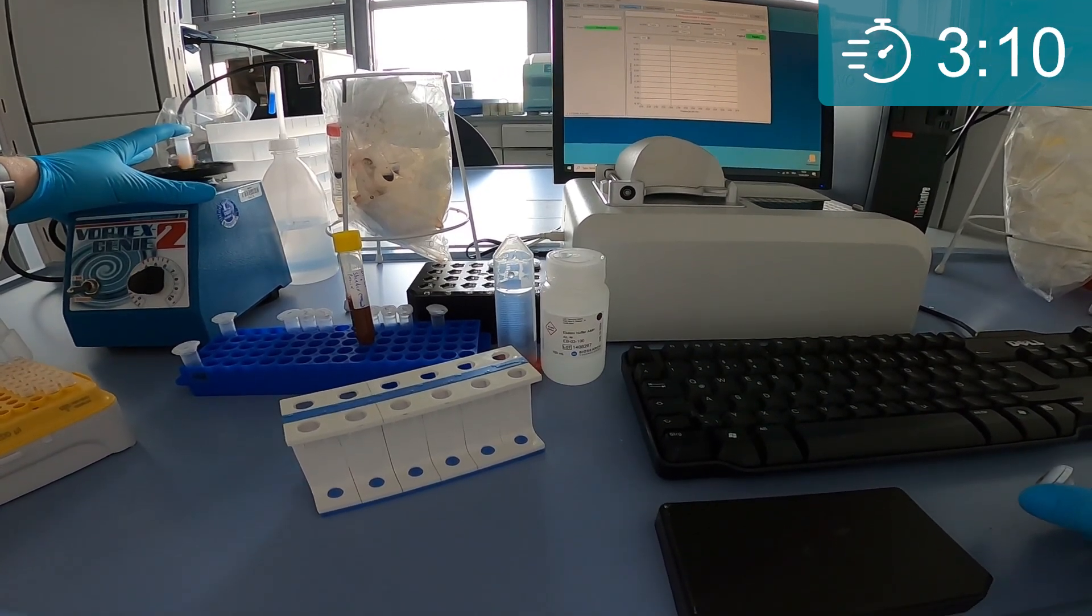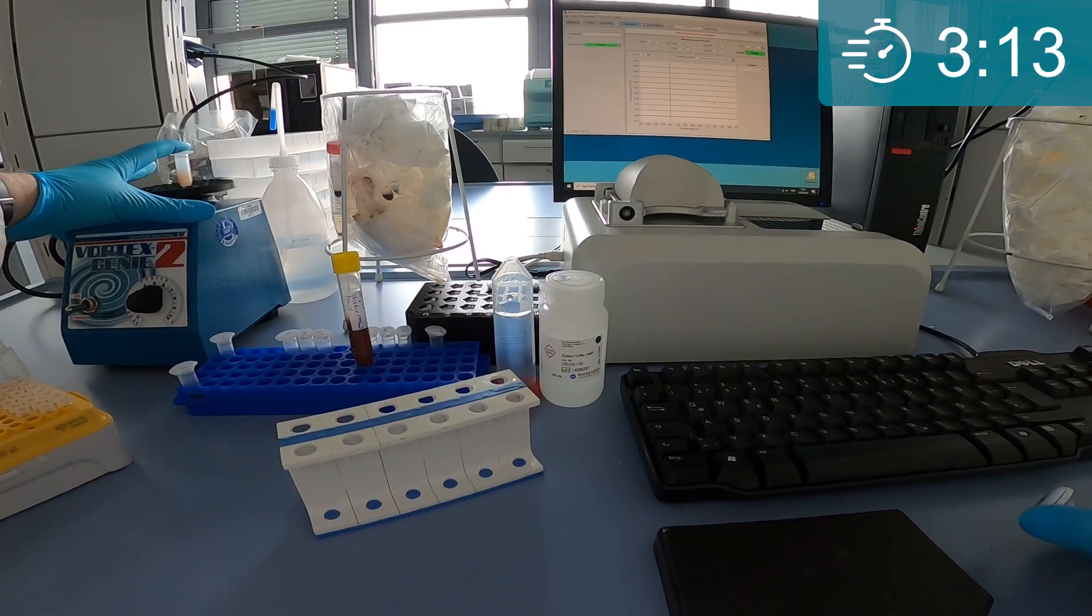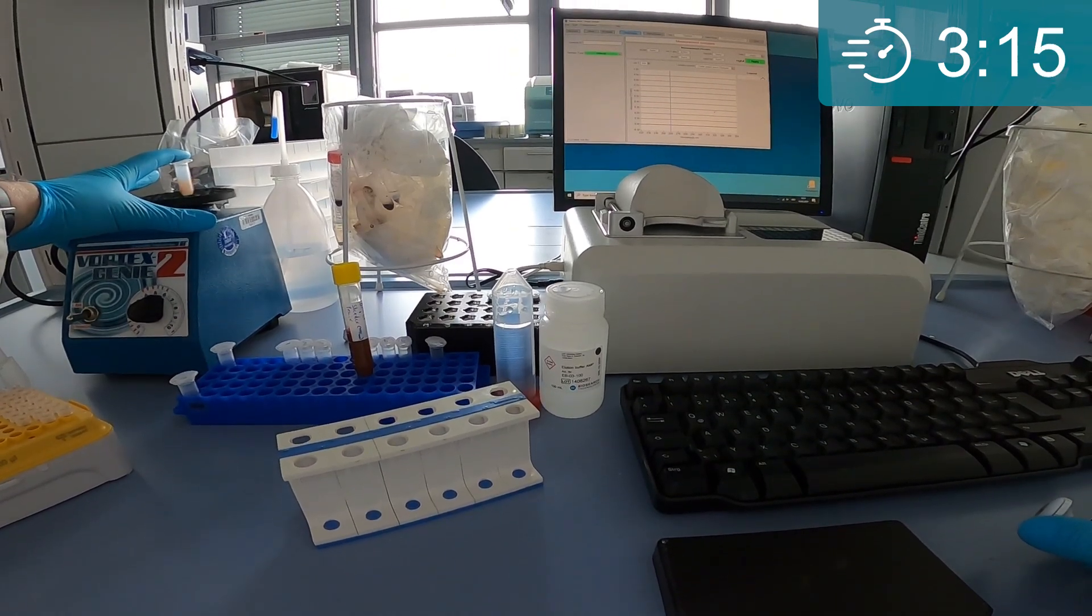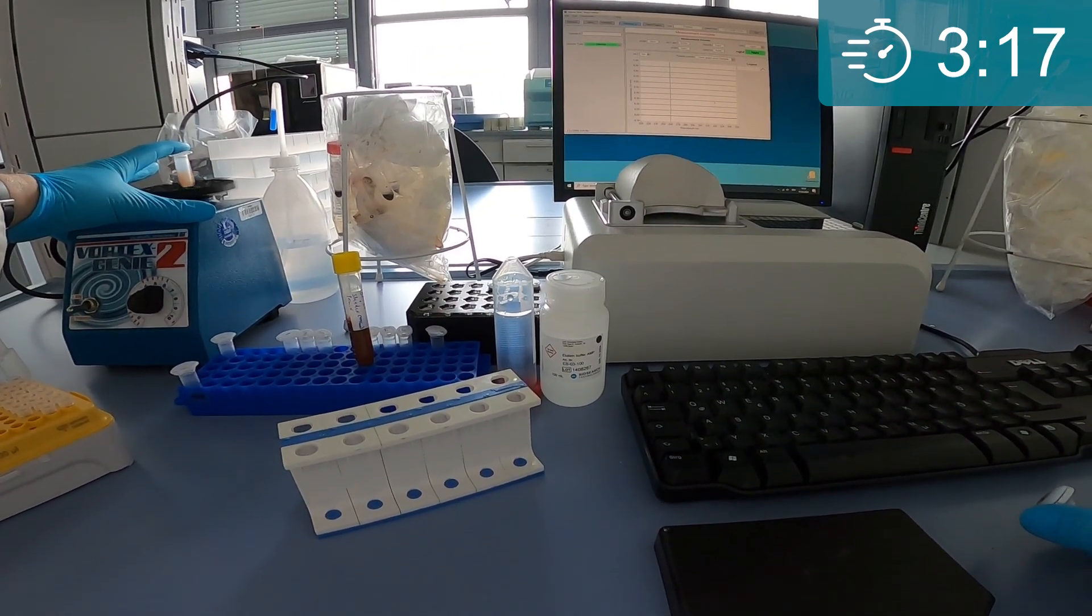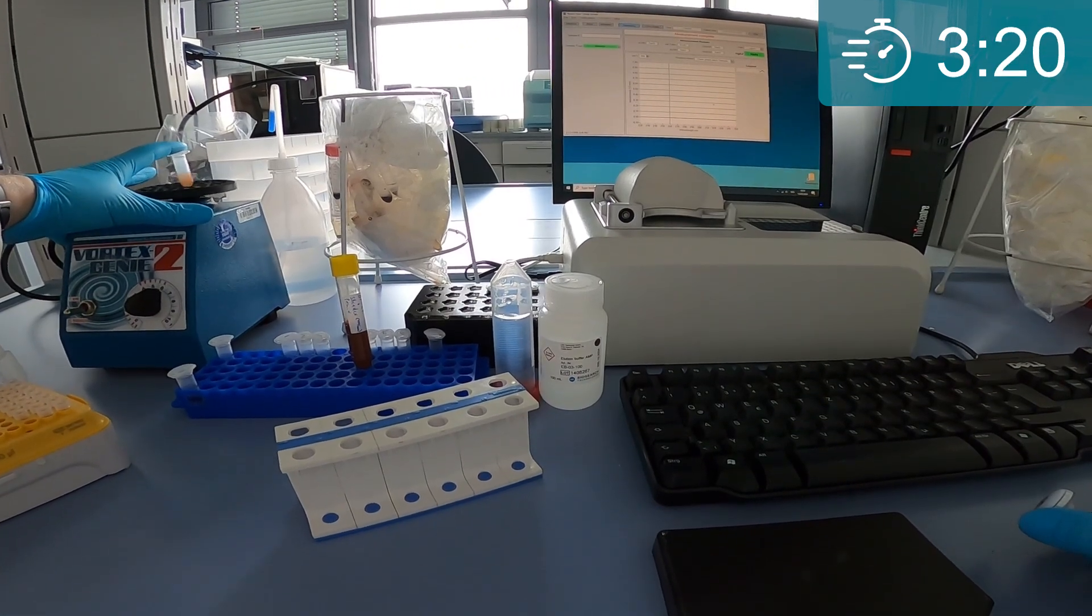Mix the beads well in the elution buffer. The elution time depends on your sample type and the mixing mode. Make sure the pellet breaks apart.